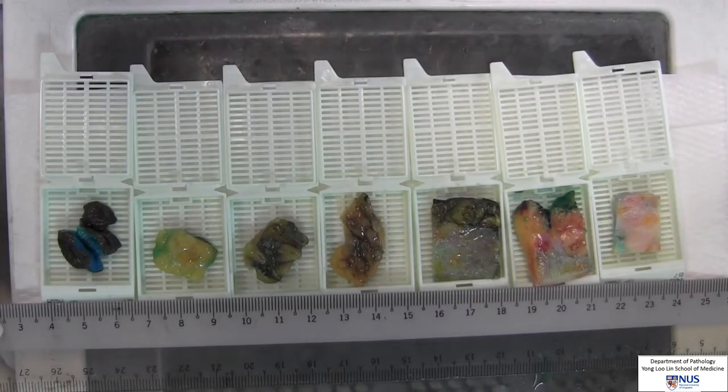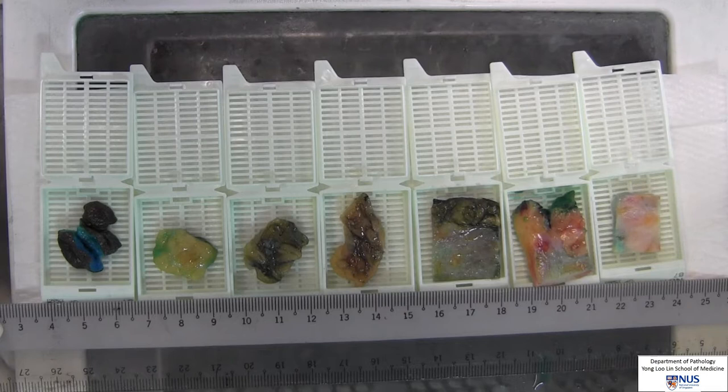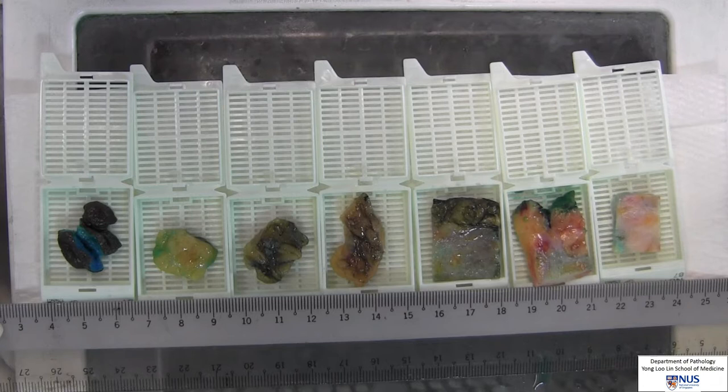These slices, together with lymph nodes from the axillary tail, will be sent for processing to be evaluated microscopically for staging and grading purposes, which we will discuss in part 2 of this video. Thank you.